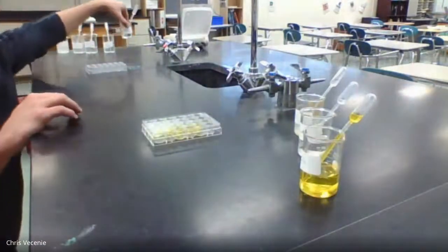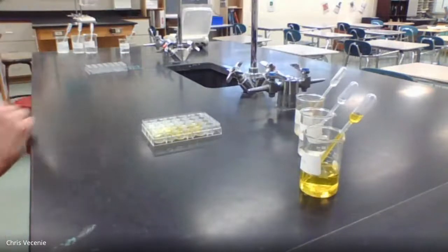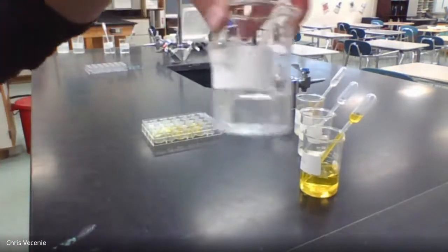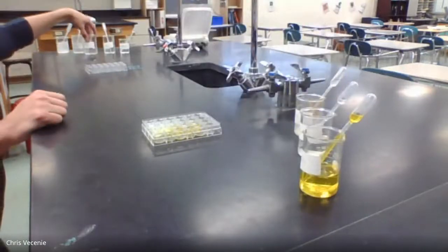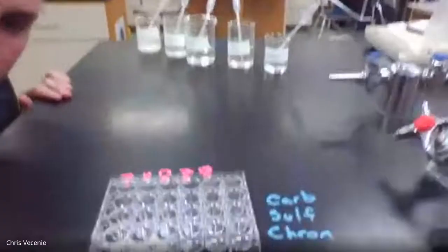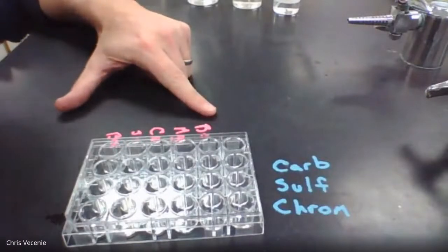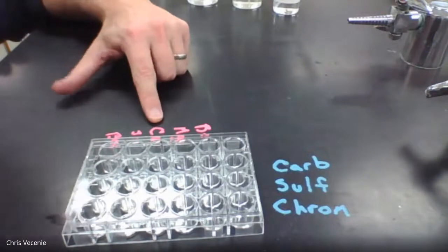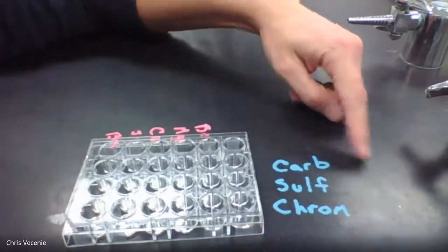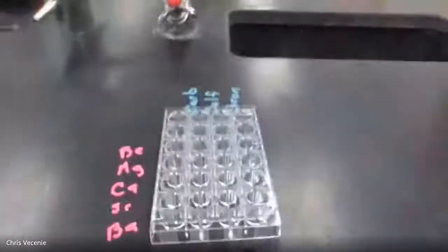If we look over here, I've got my group 2 nitrates. So here's my beryllium nitrate. Here's my magnesium nitrate. My calcium nitrate. And so on and so forth. All right, so you guys get the idea. Then if I bring you over here, tip you down, what you're going to see is that I have set up some wells. Going down the column here, I've got beryllium, magnesium, calcium, strontium, barium. There's my group 2 metals. Up here, I have each experiment we're going to do: my carbonate, my sulfate, my chromate. All right, so I'm going to try to spin you guys so that you see it the way you would if you were standing in the lab.